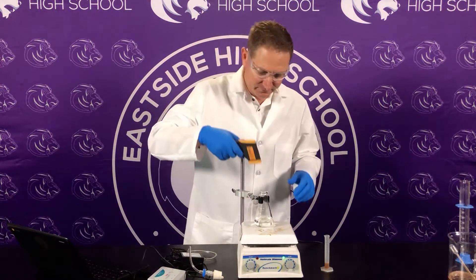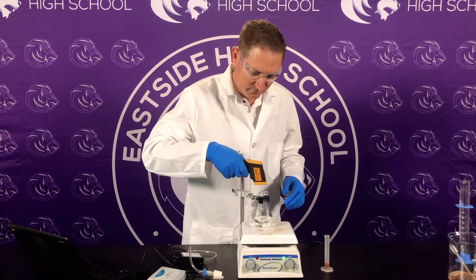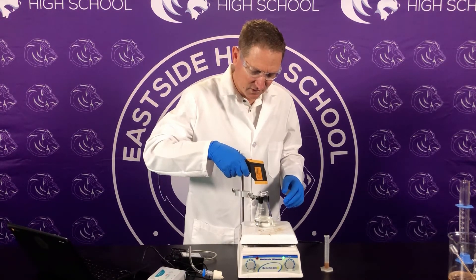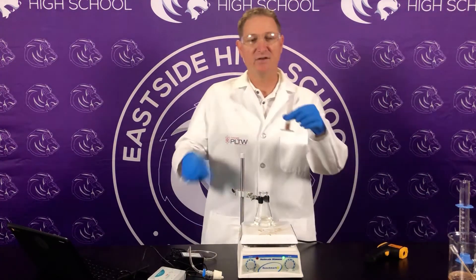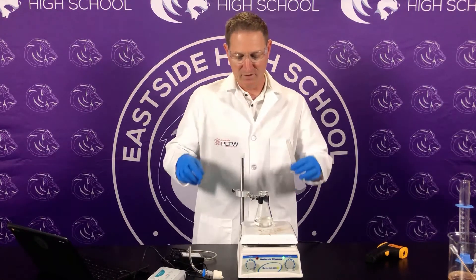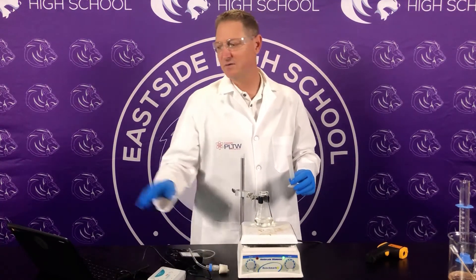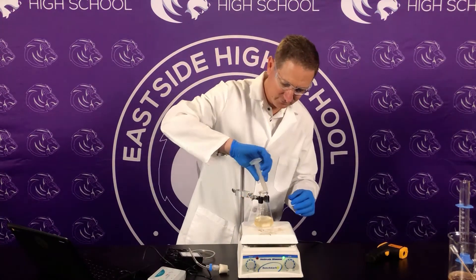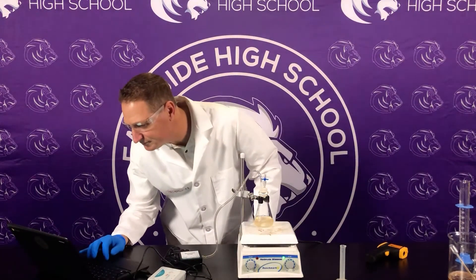Remember the original was 20.3°C — this is going to be much warmer and we're looking at 37°C. Just like every other experiment, two mls of the same catalase batch I made originally with potato and distilled water. We're going to pour this in, secure the top, make sure that stopper is closed, collect for 200 seconds and see what the reaction rate is. The reaction is already taking place — collect.